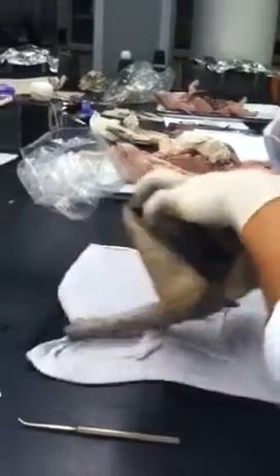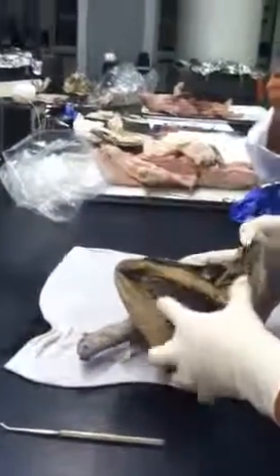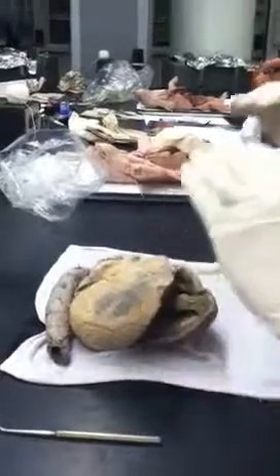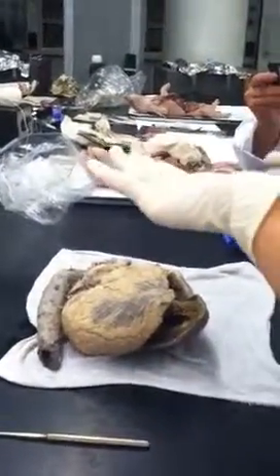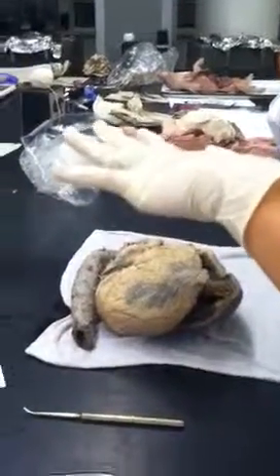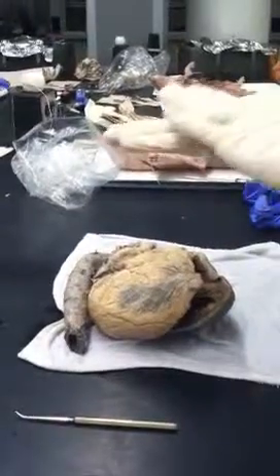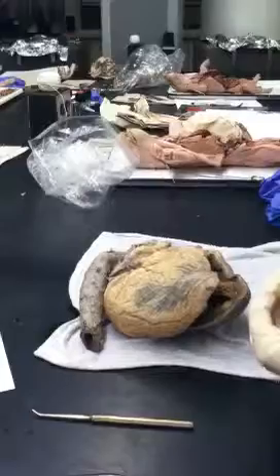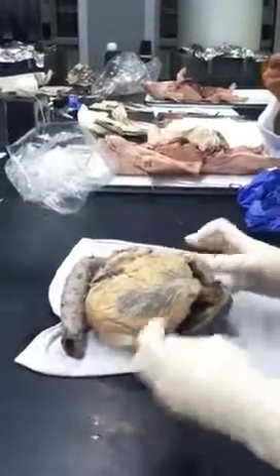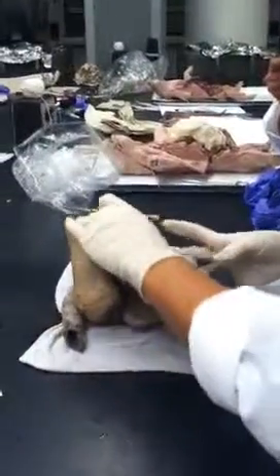So this tricuspid valve, I'll show it a couple times because it might be hard for you to see. How a tricuspid valve works is there's three cusps, right? And a cusp is kind of a flap, and then there's chordae tendineae that are like strings holding it. So the flaps overlap each other, and when the valve needs to open, the chordae tendineae pull the cusp back, and then the blood can flow through, which happens through physics and fluid dynamics that you do not need to know about, but one day you should learn because it's really cool.